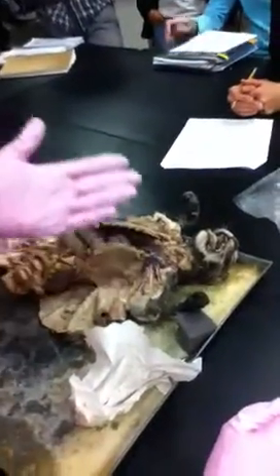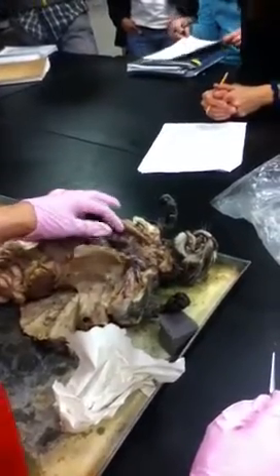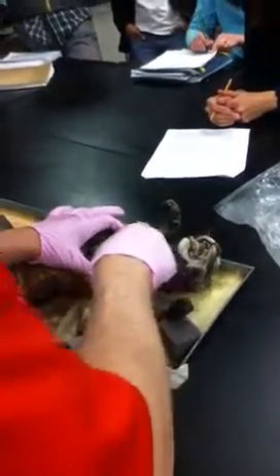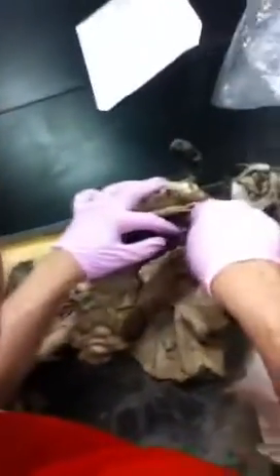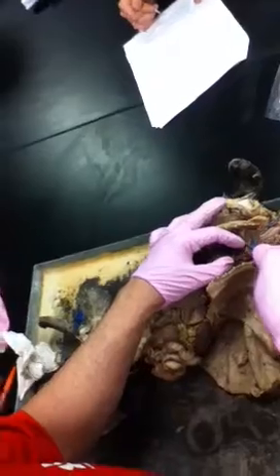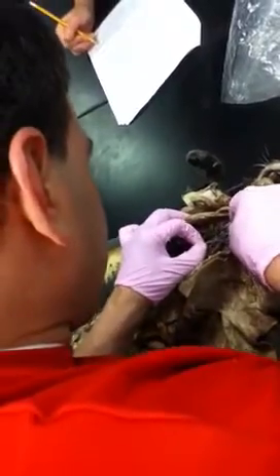And then the rest are all going to be from those pictures from My A&P or PAL, the ones that are all labeled. So going through these real quickly, the first artery we found coming off of the aorta was the brachiocephalic and then left subclavian. Then we had 3 branches coming off of that brachiocephalic, didn't we? Yes, we did.